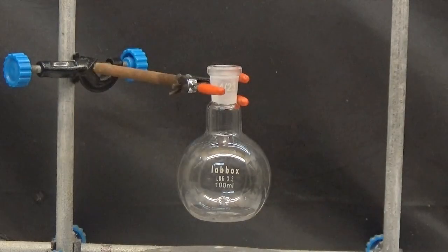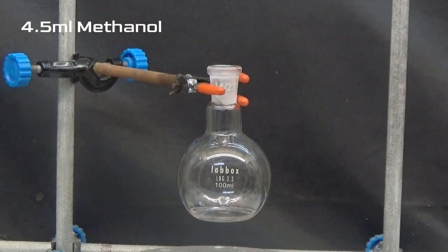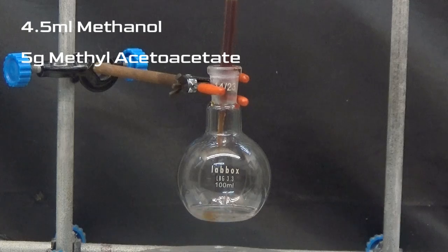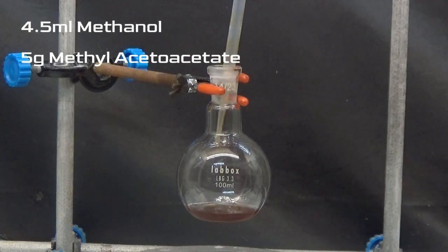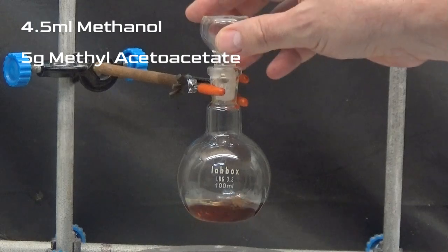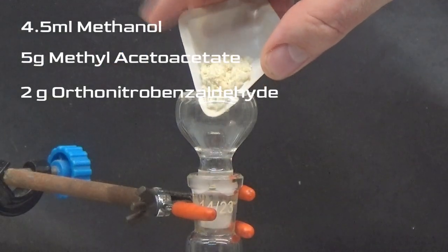To obtain nifedipine we are going to need a 100 ml flask and prepare a mixture with 4.5 ml of methanol, 5 grams of methyl acetoacetate, and 2 grams of orthonitrobenzaldehyde.